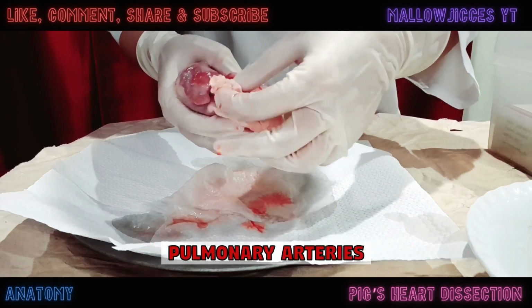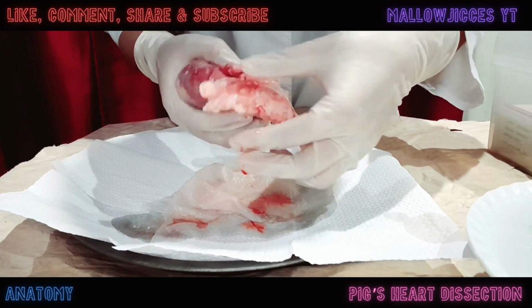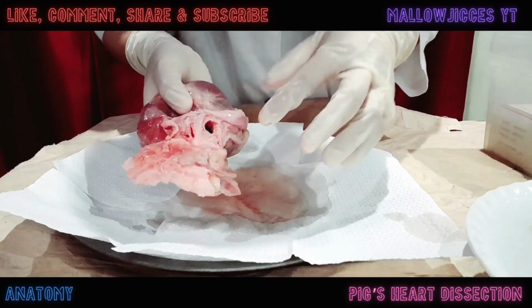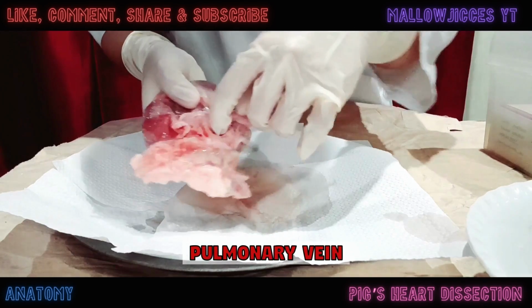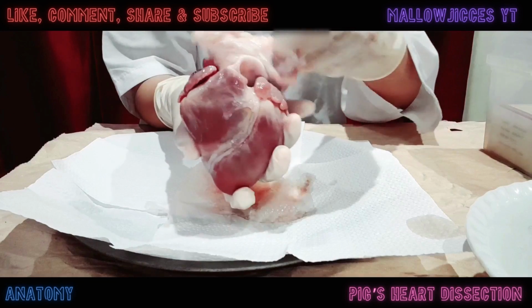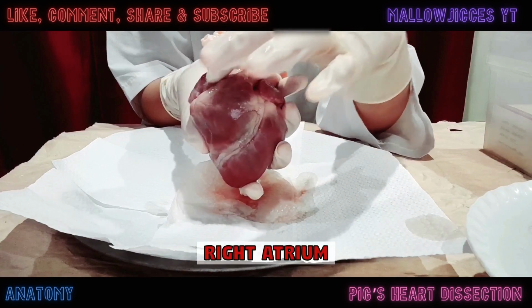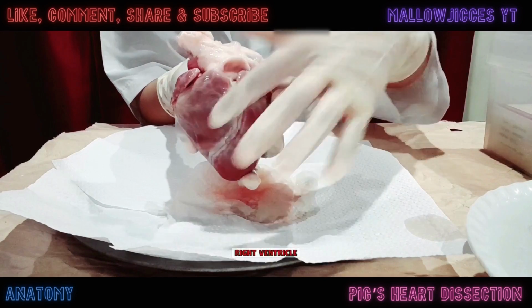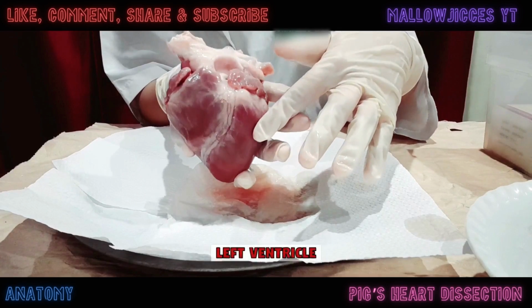the pulmonary arteries coming from the pulmonary trunk from the right ventricle, then lastly, the pulmonary vein leading to the left atrium. Next, I found 4 chambers, and they are the right atrium, the right ventricle, the left atrium, and the left ventricle.